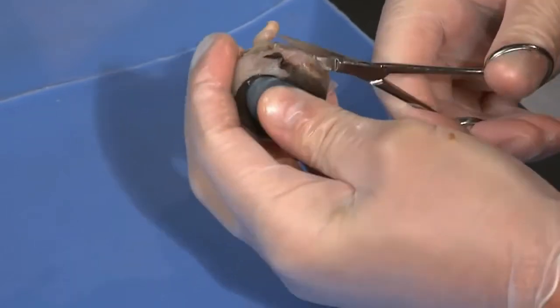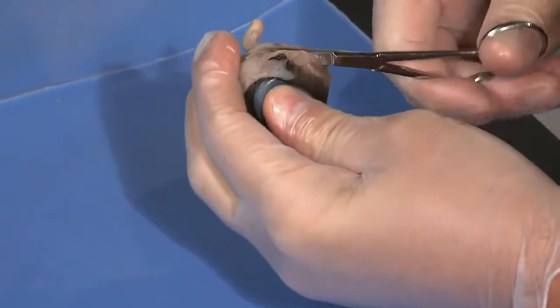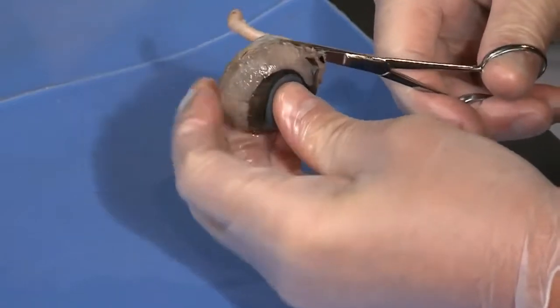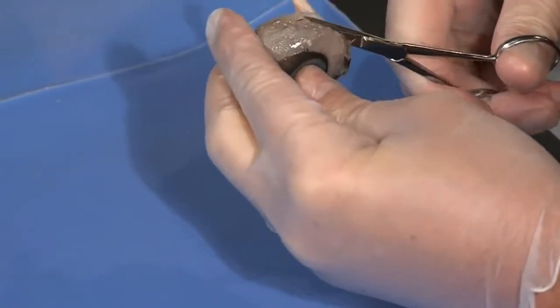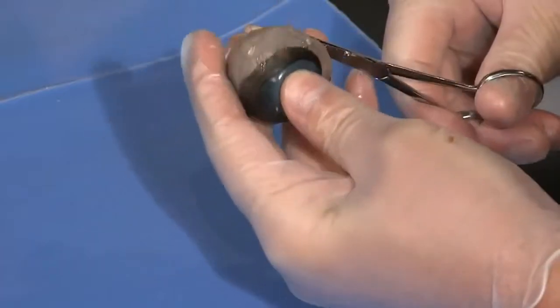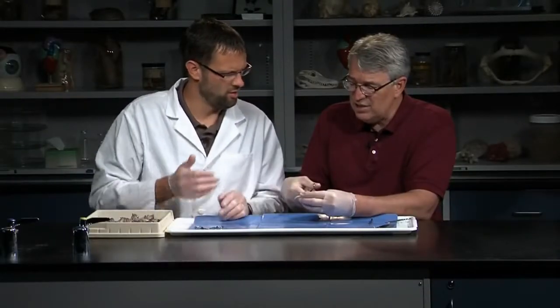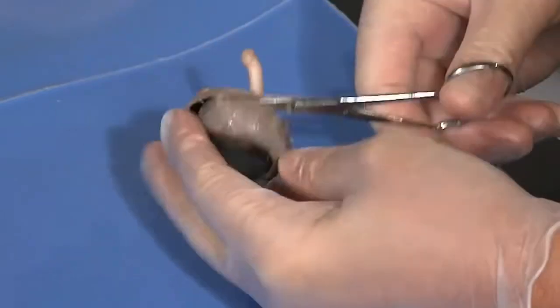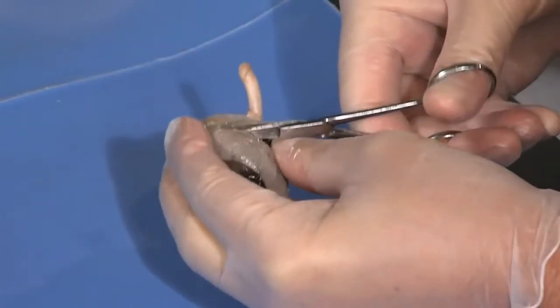If you just keep cutting, it's a pretty easy cut. Your scissors are sharper than these anyway. Go all the way around. There's no way of really messing up too much if you're in this section. You kind of want to stay in the middle and stay away from the ciliary body and such structures.